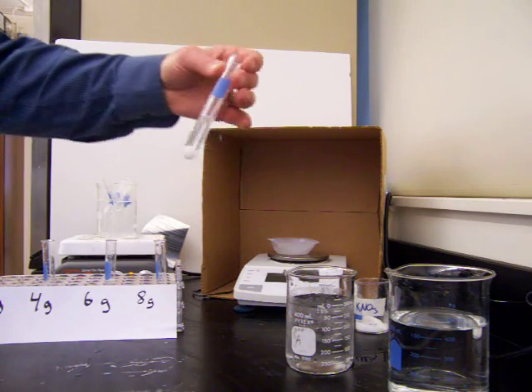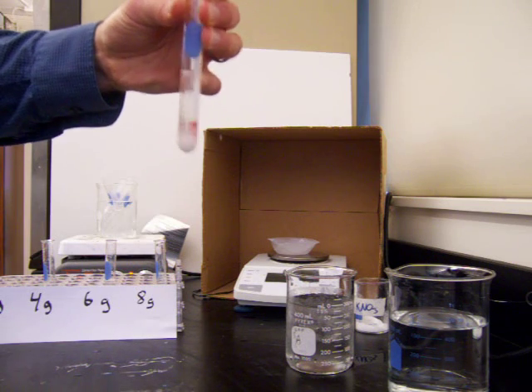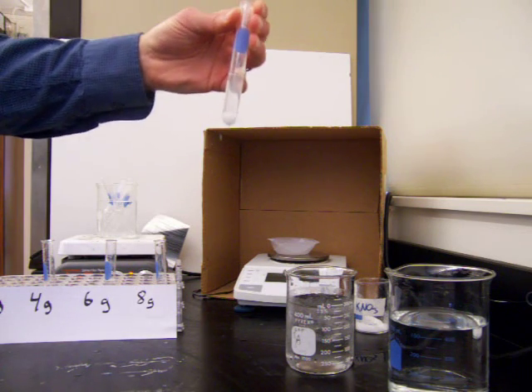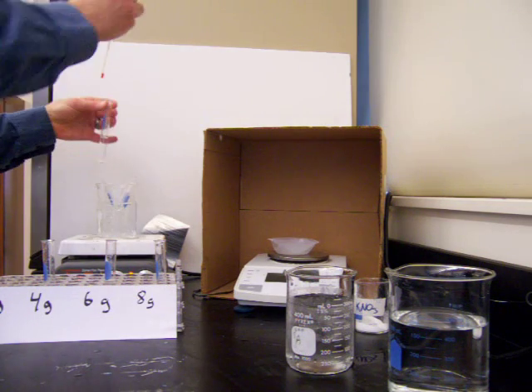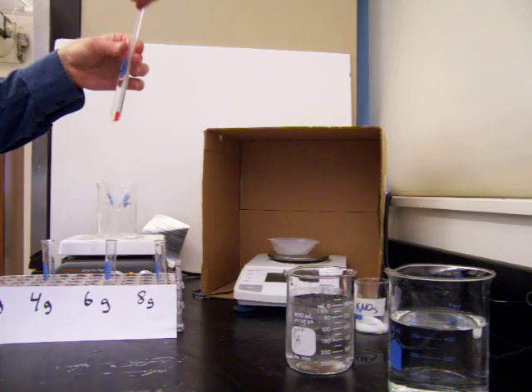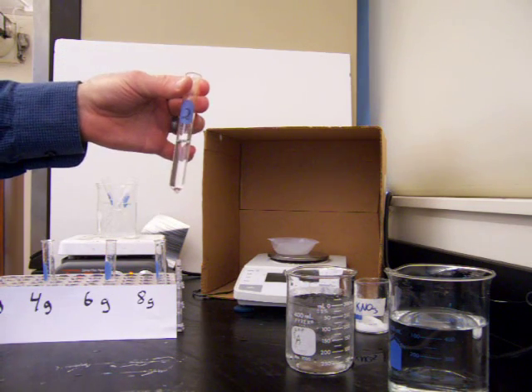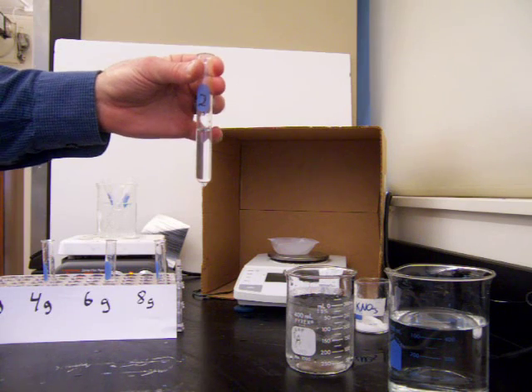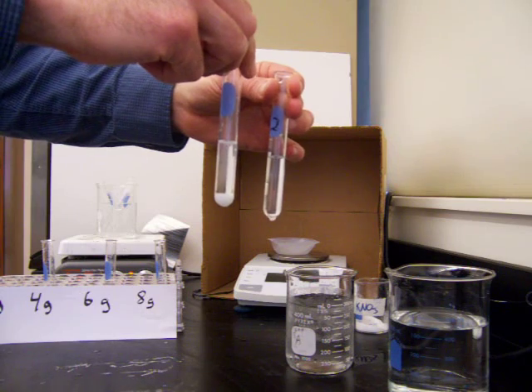This is what the salt crystals look like before they've been dissolved. You can see the little particles still in the solution. After we've heated them in a hot water bath for a little while, they'll look like this. All the particles have dissolved and you have a solution. In the solution, you cannot see any of the salt particles. Before they're entirely dissolved, you can see the salt crystals.